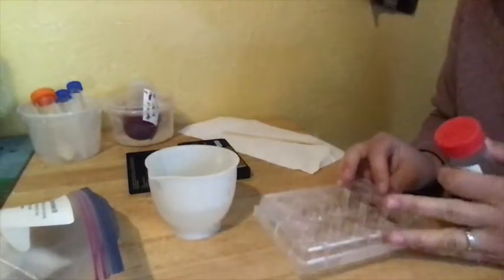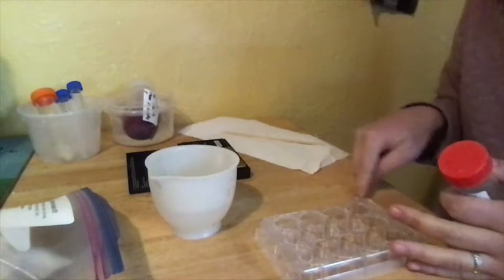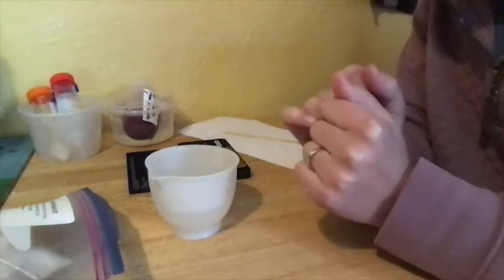All right, so at this point, you want to get your well plate, just like in your pre-lab, put it on some white printer paper, and label the different rows. And now we're going to make your beads.